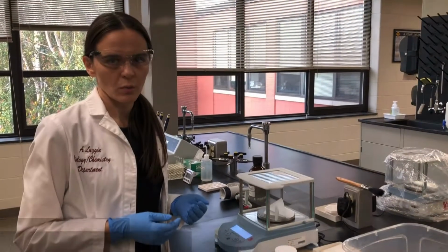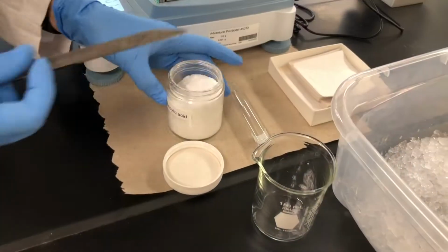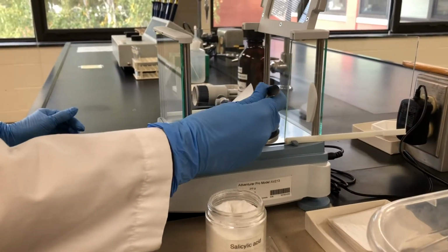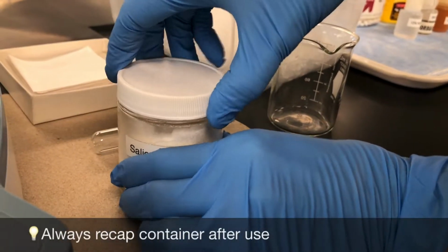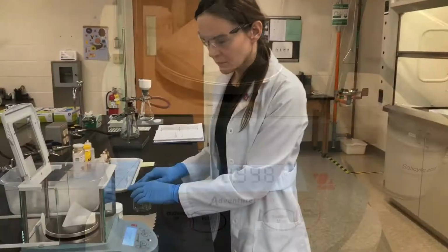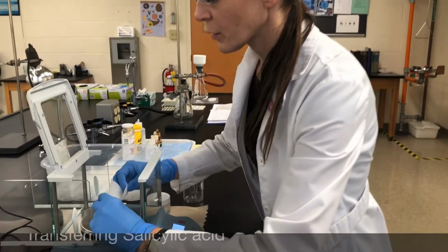Now what I'm going to do is weigh out a little under a gram of the salicylic acid, so that's the main ingredient used to make aspirin. So I'm picking up my weighing paper, both hands.